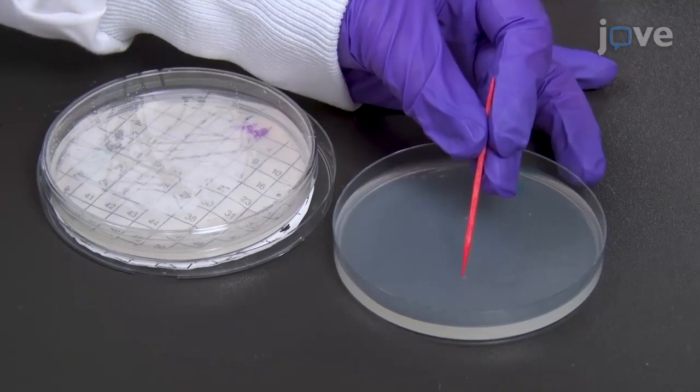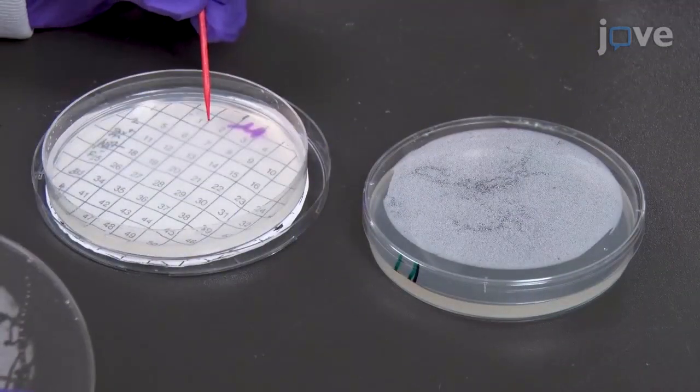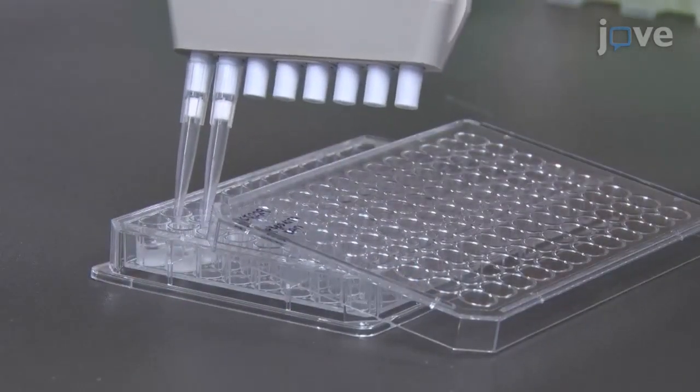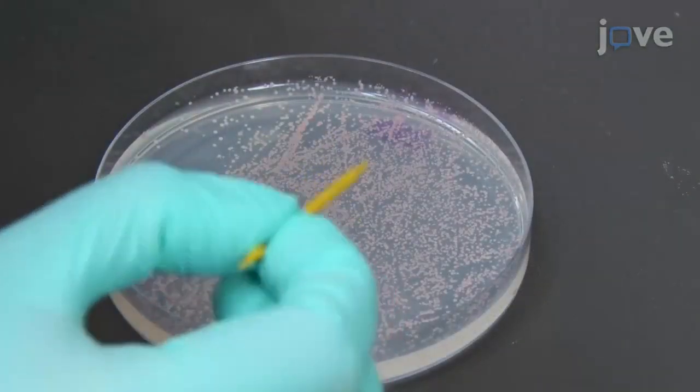Yeast toxicity and suppressor screens can provide key insight regarding the natural biological target of bacterial effector proteins and can be particularly useful when a binding partner is unknown. We demonstrate the yeast toxicity and suppressor assays here for screening Chlamydia trachomatis effector proteins, but this technique has also been used for characterizing Legionella pneumophila and Coxiella burnetii effectors.